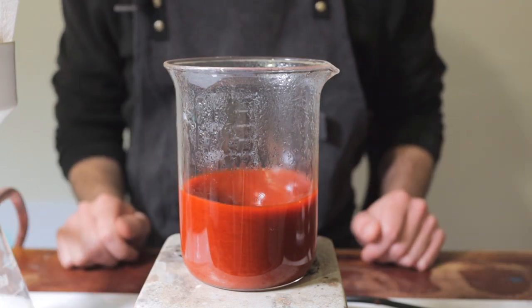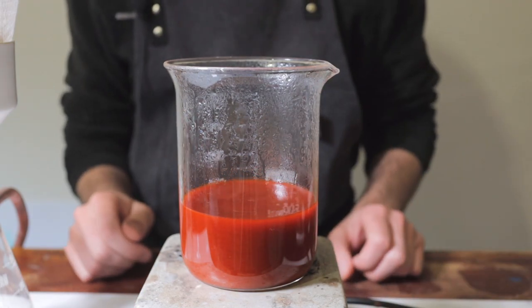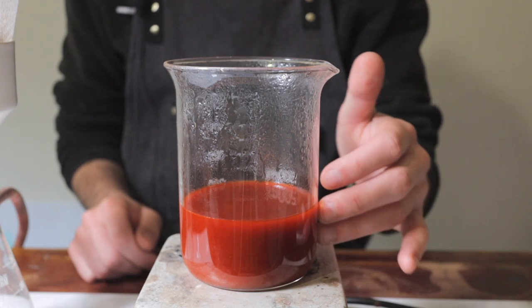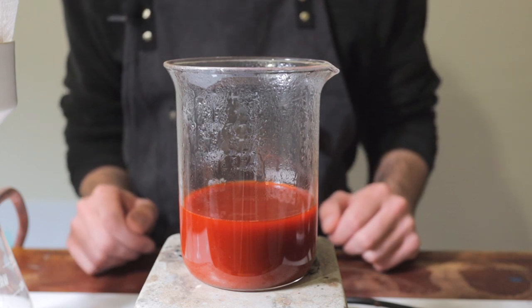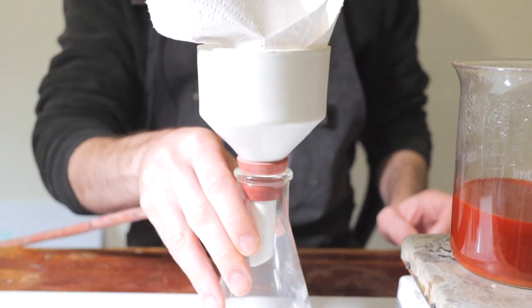It's been about an hour and it's time to stop the stirring, turn off the heating, and move this off the hot plate. As you can see, we've started to collect quite a nice rich rusty red liquid here as our extract or decoction. We're going to run it through the trusty filter funnel.